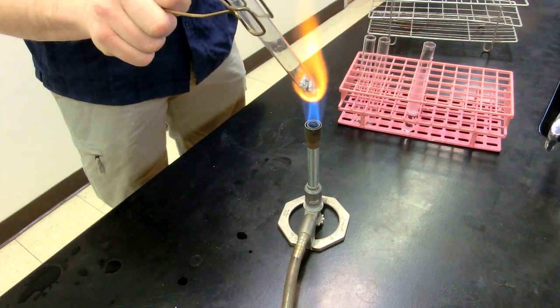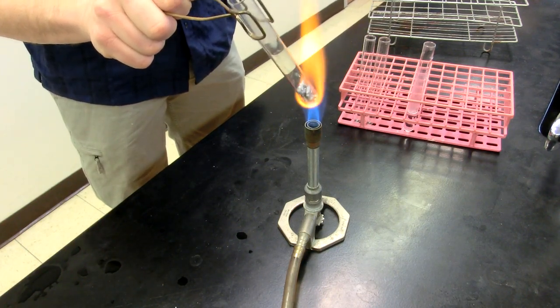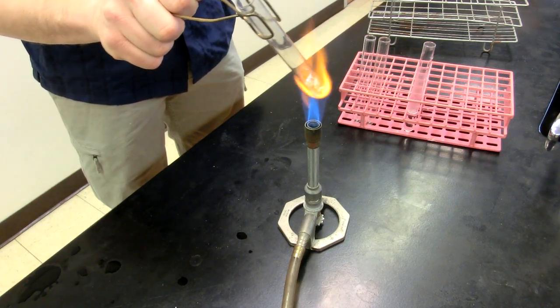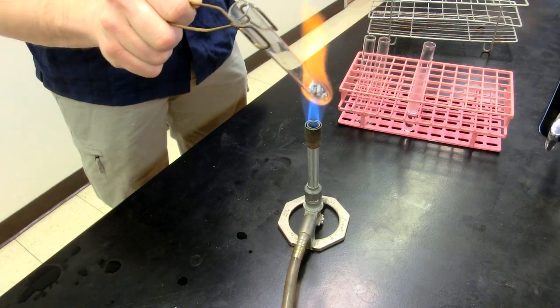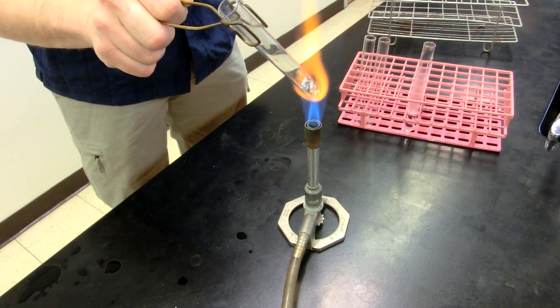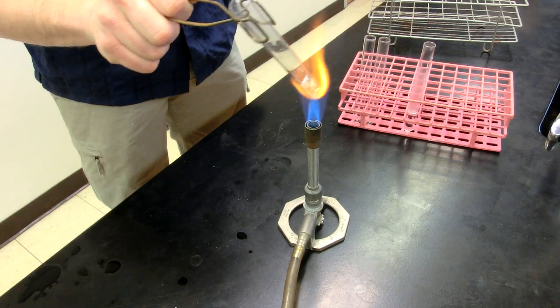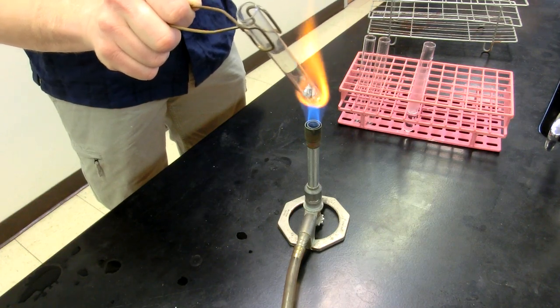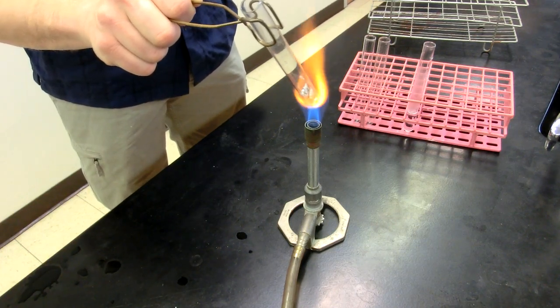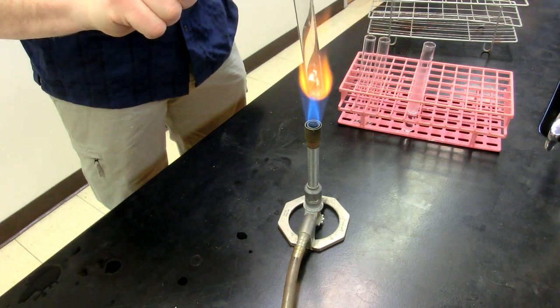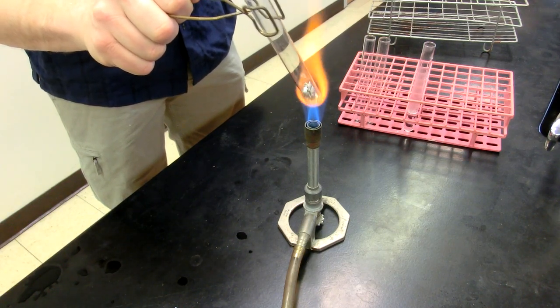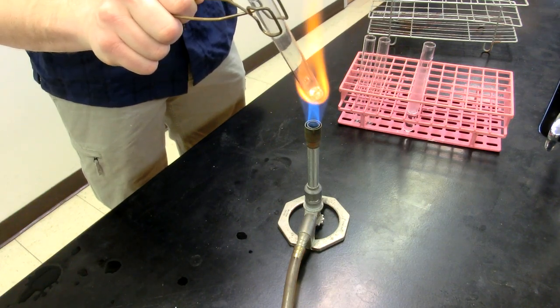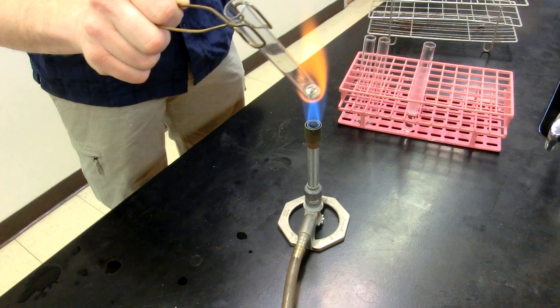All right, starting to melt now. With some of these, once they get heated up you could actually probably hold it or move it a little bit slower in the flame. Some labs will even instruct you to leave it directly in the flame itself, kind of like this. But please make sure you follow the procedure that is given to you by your instructor or by the lab technique that is described. All right, so it is starting to melt. There we go, and it's almost completely melted.